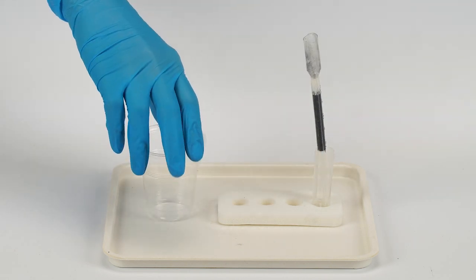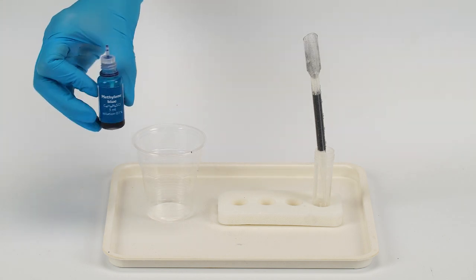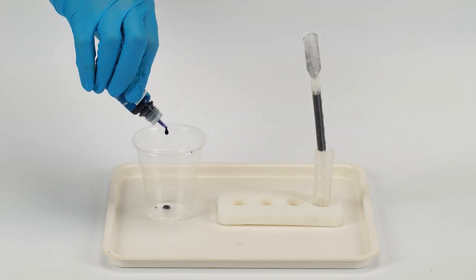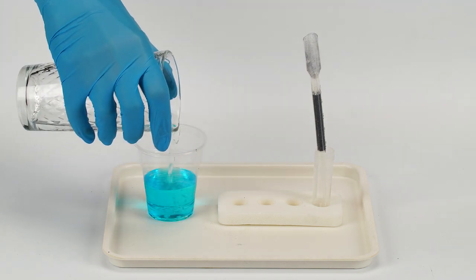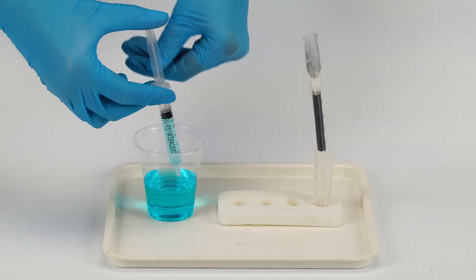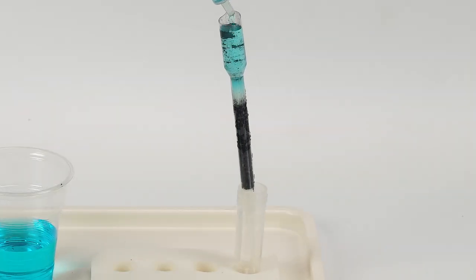Prepare an organic pollutant solution using water and methylene blue. Measure five drops of methylene blue into your disposable plastic cup. Fill the cup halfway with water. Transfer some of the methylene solution to the filter using a syringe. Add two to three full syringes gradually.